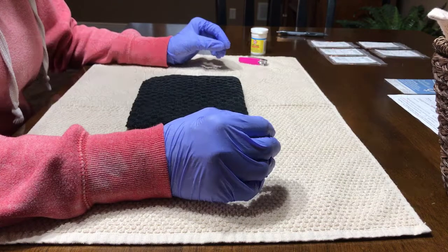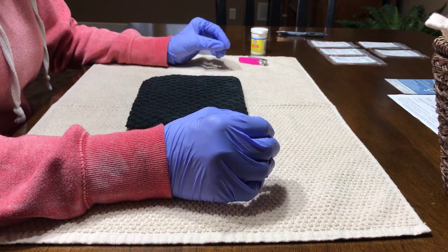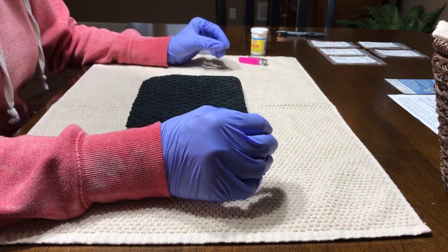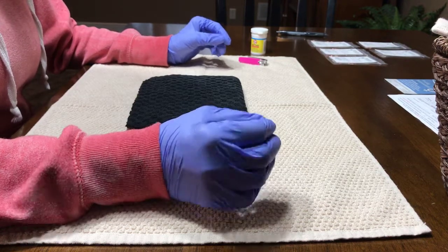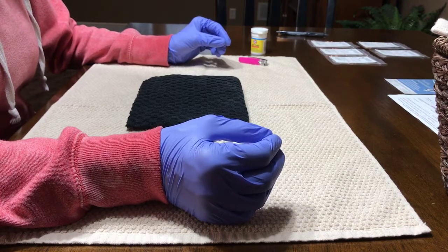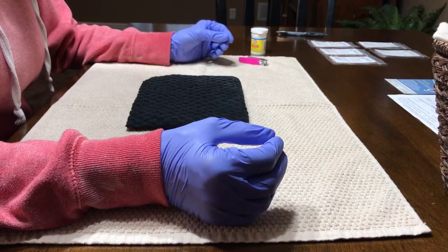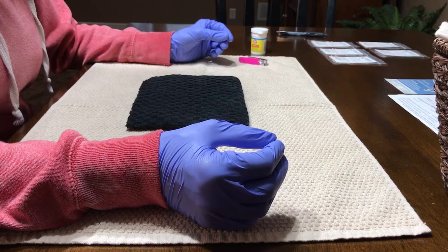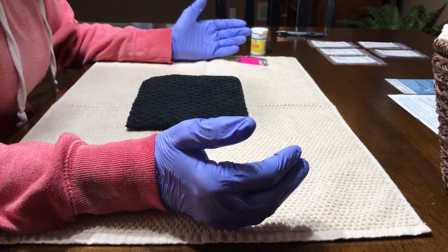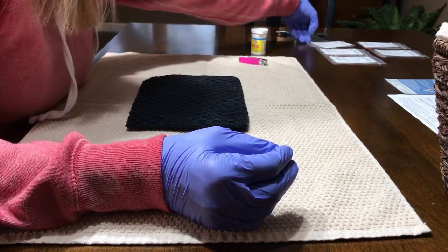We're going to do a really fun video today on how to DNA sex a parrot. There are a few different ways you can do it — some people take a blood feather and send that in. We do not choose to do it that way. We are going to clip their nails, because these are babies and their nails are very, very sharp, so they need their nails clipped anyway.